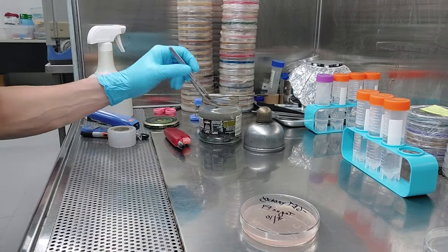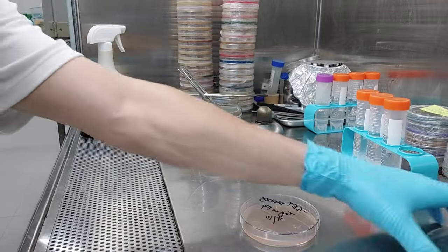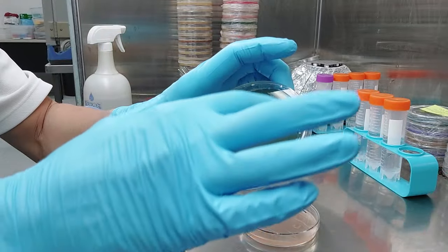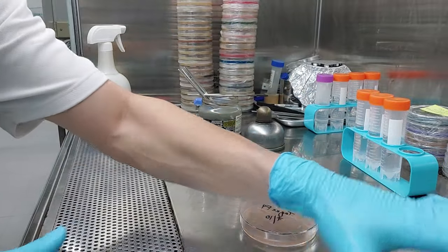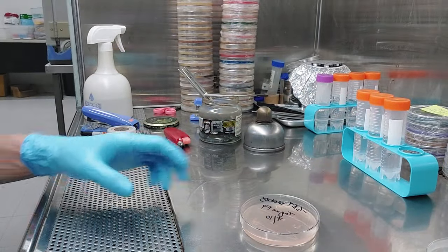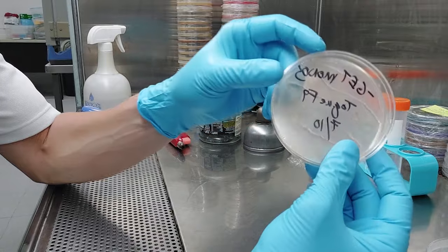Very tiny piece of agar, put it on there too. I will check those after about four or five days. They'll grow out. Do not let them grow into each other. Hopefully one of those will not have clamps. I did eight of them, hopefully one out of eight. A couple things I noticed: I should have made the agar stiffer.